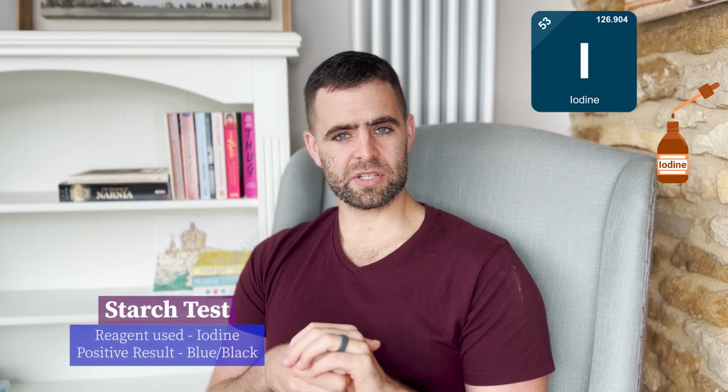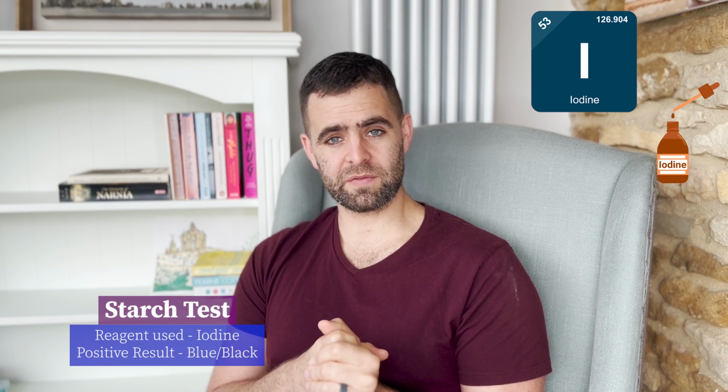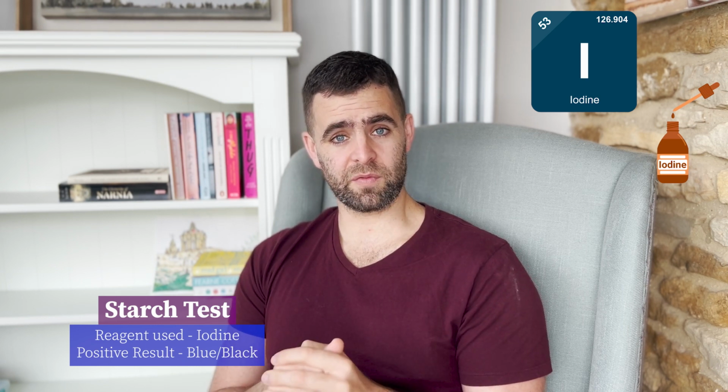Now, how can we remember and match up the name of the test to the actual thing that we're testing for? Well, let's start by looking at iodine. Iodine is usually a brownish, orangish type substance. I can't give you a great hint as to how you can remember which one this tests for, but this is a really simple one because it's testing for starch. If we think about a nice white piece of bread, if we drop that iodine onto it, it's going to turn a very dark black or dark purple color. And that tells me, yes, starch is present.